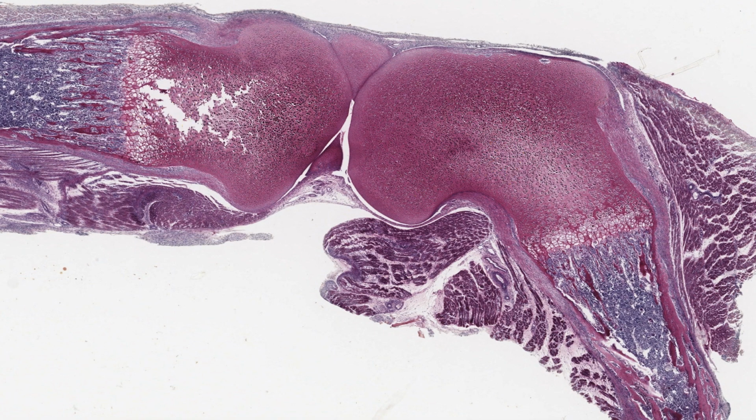Since these cartilaginous masses include the epiphyseal ends of the bones, scanning along them will show all the stages of endochondral bone formation. I'm going to describe this process viewing this region here in higher magnification, which is just adjacent to the zone of reserve cartilage where growth is going to begin.